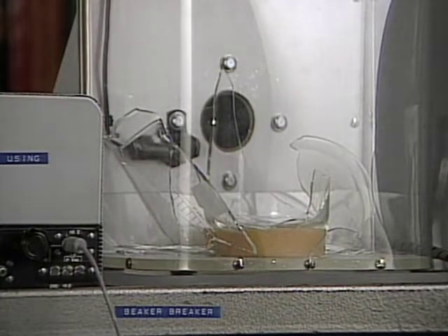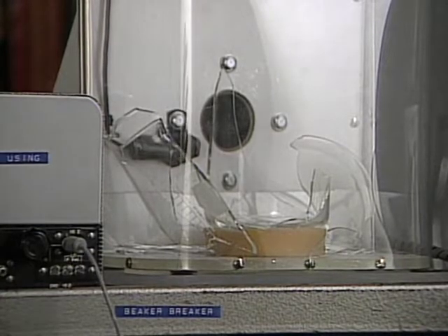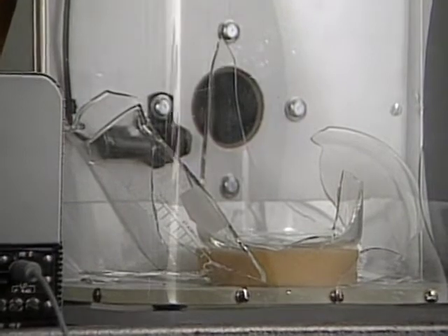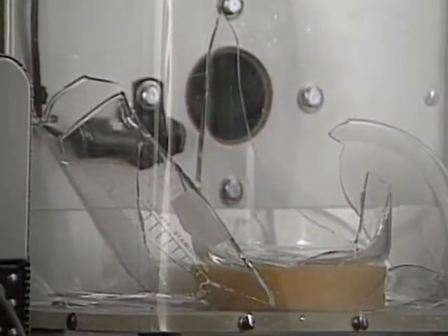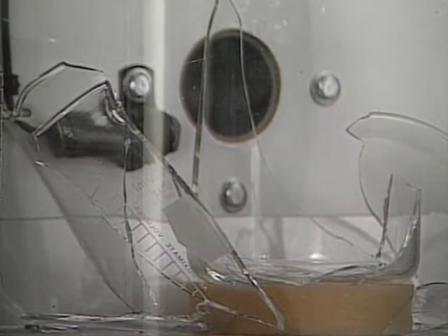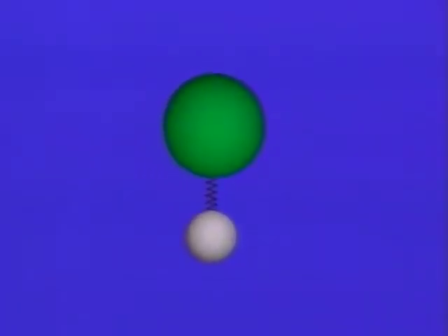On the molecular level, the picture is more complex than this sound wave analogy. Molecules may absorb several different radiation frequencies depending on their energy levels. And each frequency must provide the exact package of energy needed to lift a molecule from one energy level to the next. For example, a vibrating hydrogen chloride molecule exists at a specific energy level. A specific package of energy is required to make it vibrate at the next higher energy level.